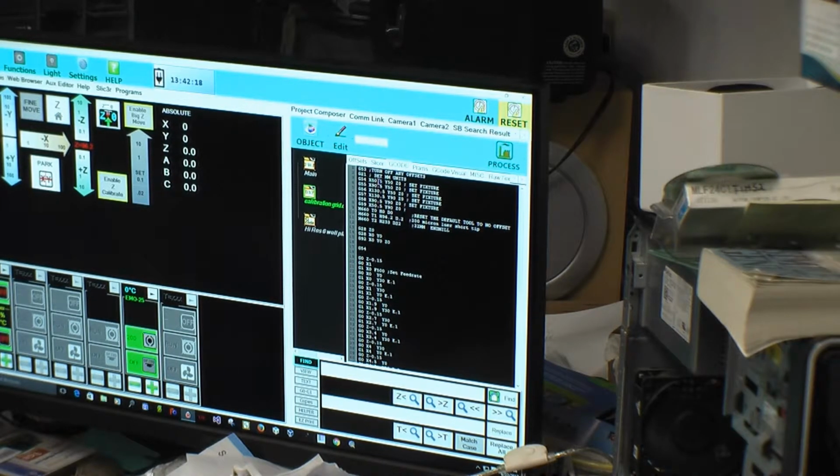All right, I'm gonna put 0, 0 as the offset on there, so we start right there. And then it's gonna run a G54 and G0, X0, Y0. Control copy. Boom, boom. And this is where you put your H, which is the tool height, and it looks it up from the table. So if you had 8 tools or 5, you put H1, it goes to the first one. H2 goes to the second one.